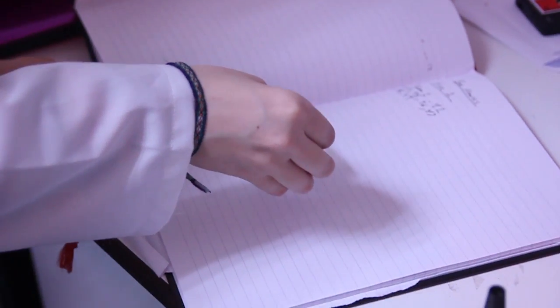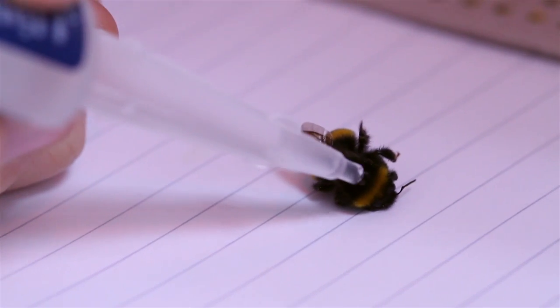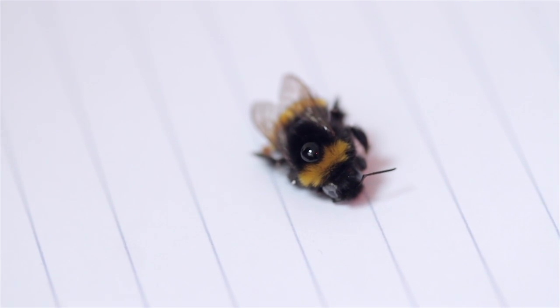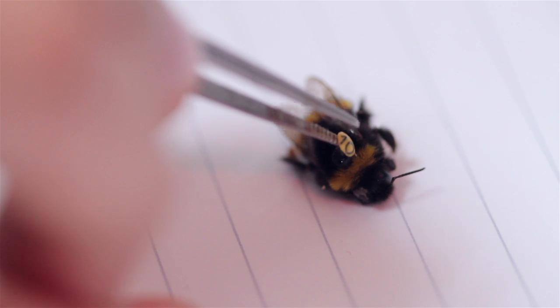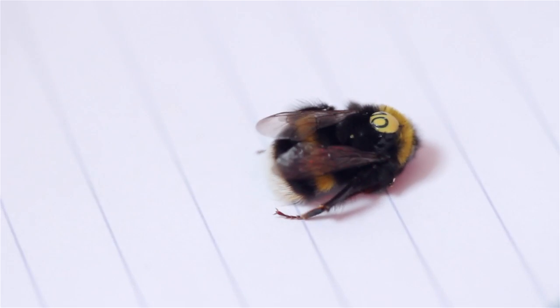So here we have a chilled out bee. It's just like it's woken up on a cold spring morning. I'll just dab a tiny little bit of superglue to the top of the head. I have to be careful not to get any on the wings, and not to get any on the legs or antenna. Now this is the fiddly bit. I just sit it on top of the dab of glue — there we go. That is number 10.